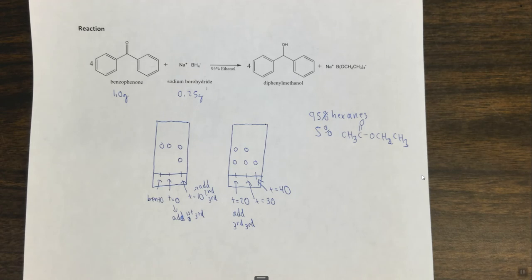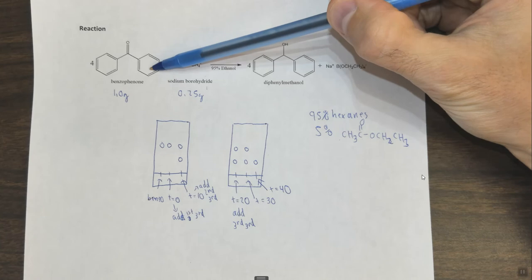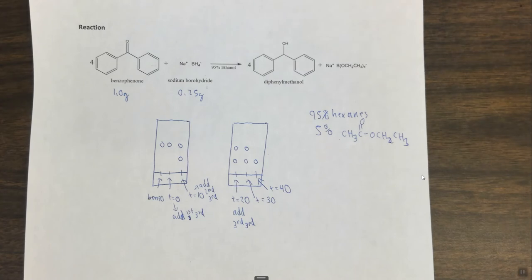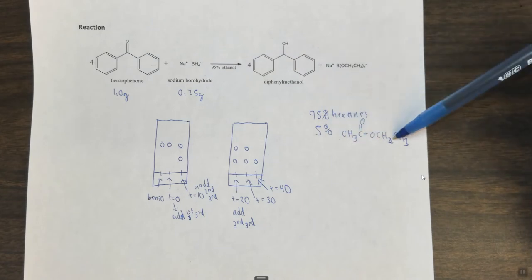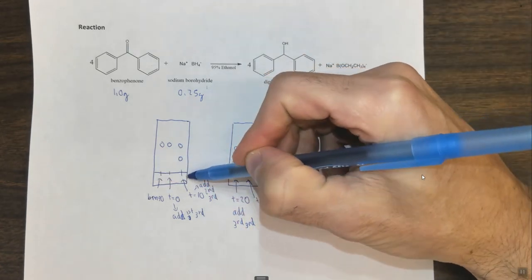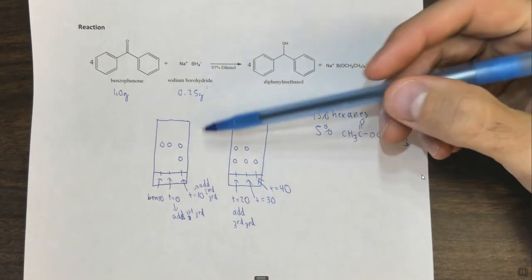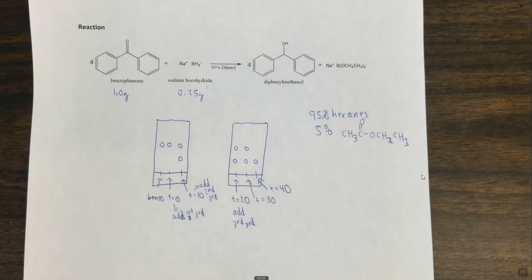As far as the physical procedure: this is a fairly straightforward reaction. You're going to dissolve the benzophenone in less than 15 milliliters of 95% ethanol in a 50 mL Erlenmeyer flask and stir it on a stir plate. You'll add one third of the NaBH4 at the prescribed intervals and monitor reaction progress by TLC. You'll develop the TLC plates by putting a small amount of 95% hexanes and 5% ethyl acetate in the bottom of a beaker, placing the TLC plate in so the solvent level is below the spots, and allowing capillary action to draw the solvent up. Then take them out, dry them, and use a UV lamp to visualize your spots.